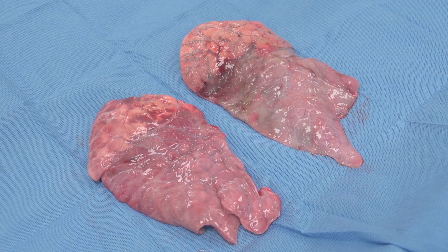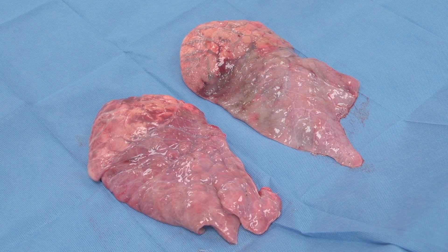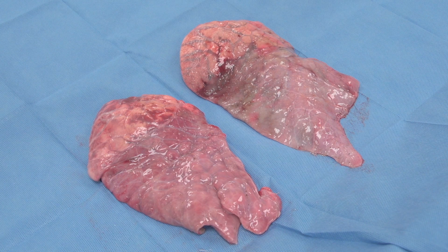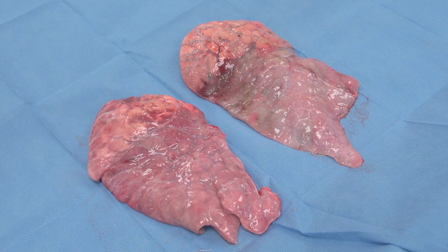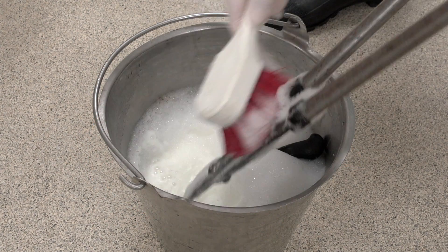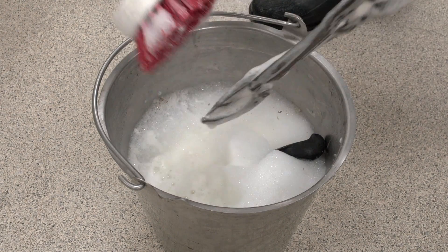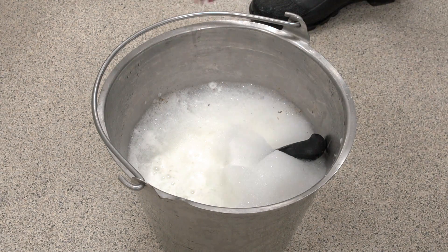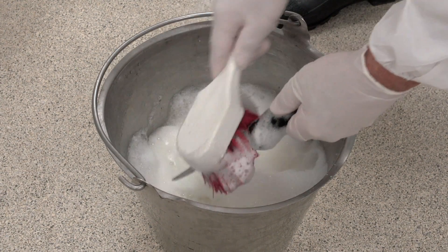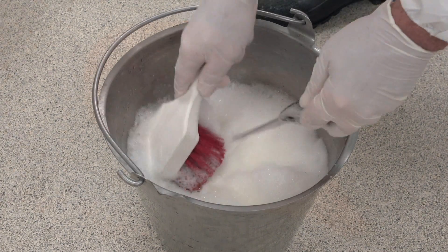When a complete necropsy is to be performed and BRD is suspected, the lungs should be sampled prior to collecting any other samples. If multiple animals are to be necropsied and you are not pooling samples, a thorough cleansing of your necropsy tools is recommended to reduce cross-contamination.